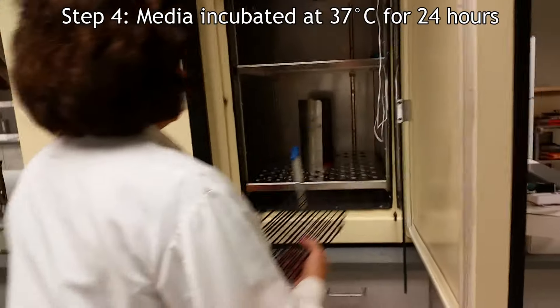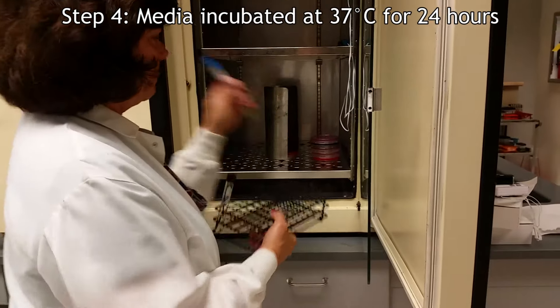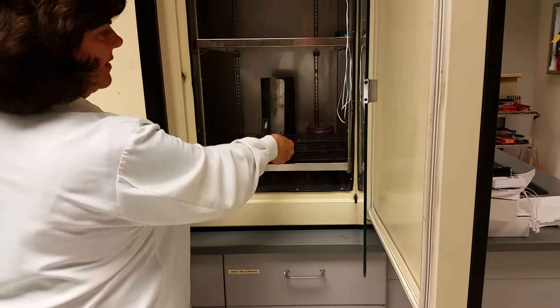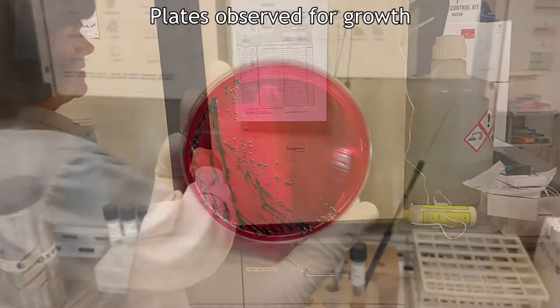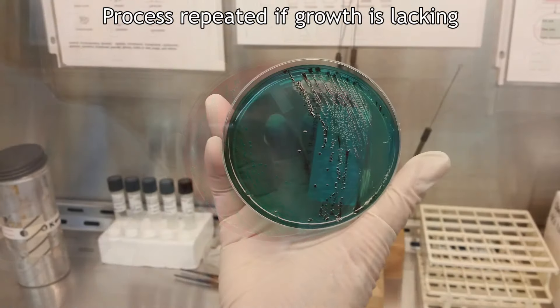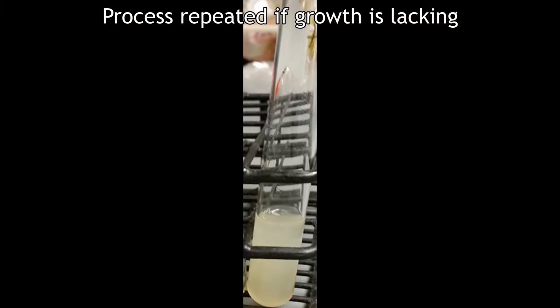Lastly, the enrichment broth and agar plates are incubated for 24 hours at 37 degrees Celsius. After incubation, the plates will be observed for colony growth. If growth is lacking, this process will be repeated using enriched bacteria from the inoculated media broth.